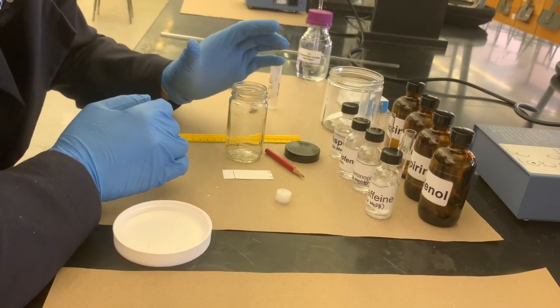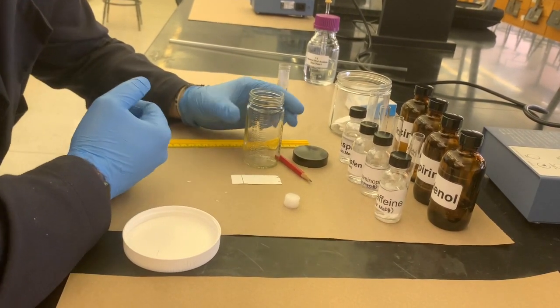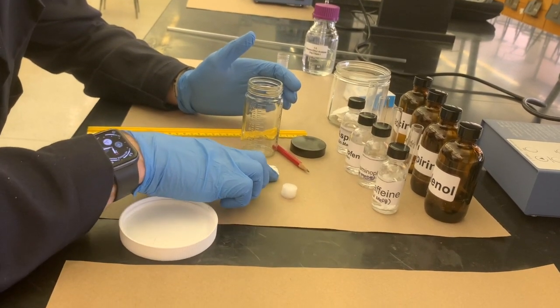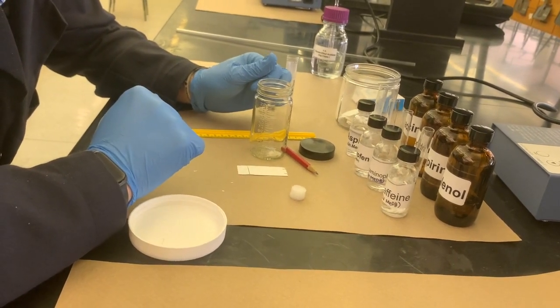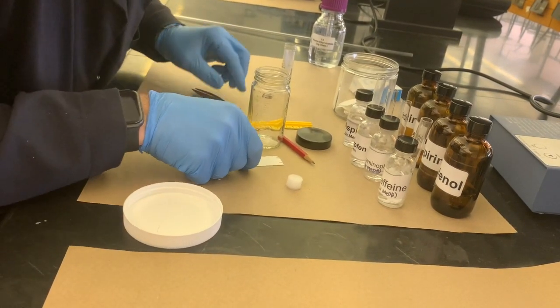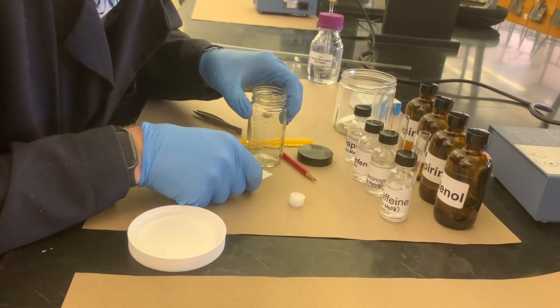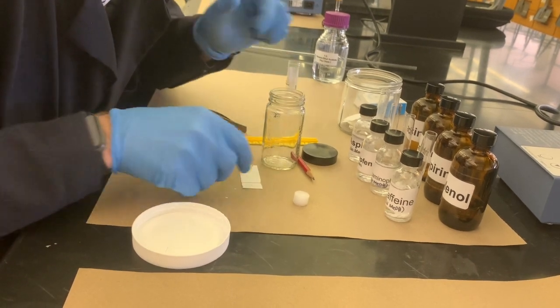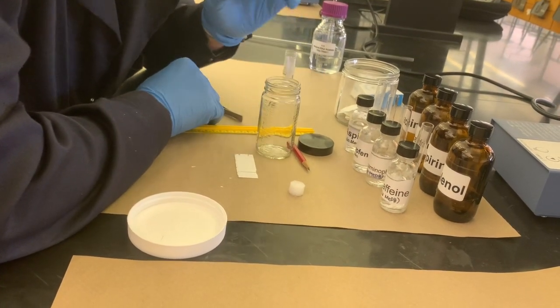You don't want to allow your sample or your TLC plate to run too long. If you let it run too long, as I mentioned before, the samples will run past the point where they would have been expected to stop based on the consistent results you were hoping for. So if you take your TLC plate and place it in ahead of time and pour in solution, that's going to be less than ideal. And here's why. You want to consider the point that you put that TLC plate into the chamber to be the very starting point.